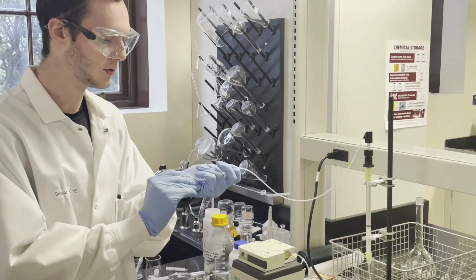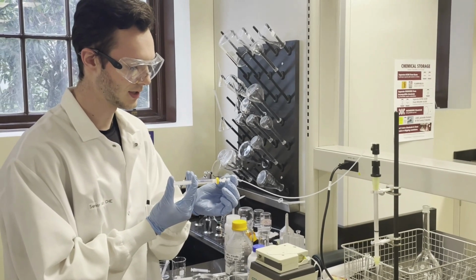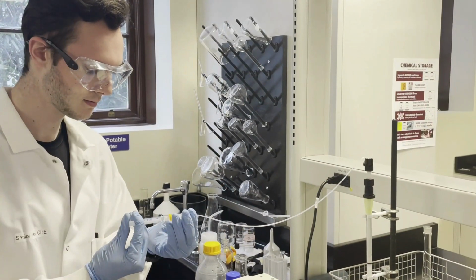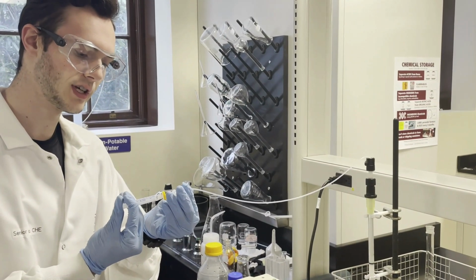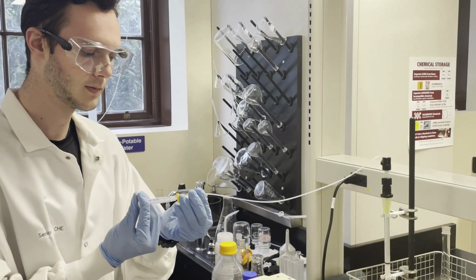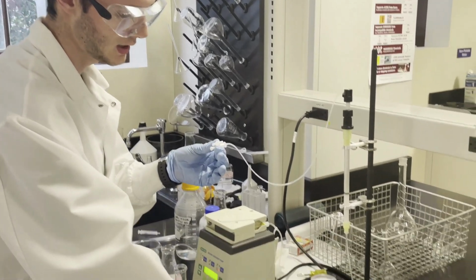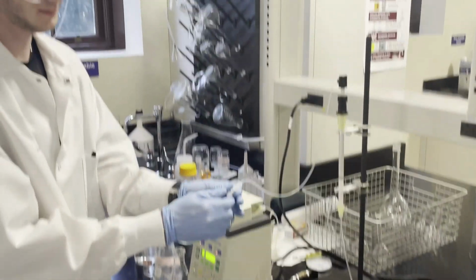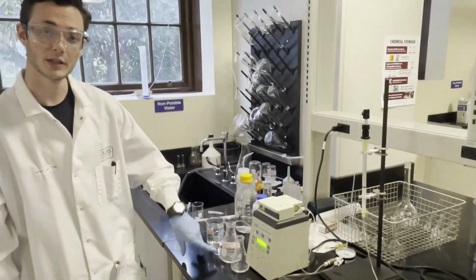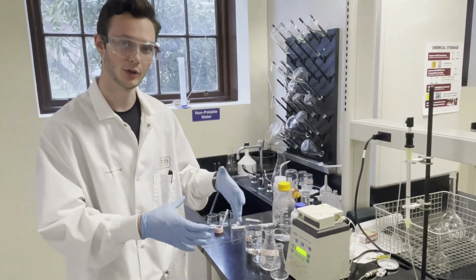Now, I'm going to very carefully start applying pressure and loading the proteins into the column. And so now that we're reaching the end, we want to make sure we get every last little bit of protein out, and then we just disconnect the same way we connected and connect it back to the pump. Voila. Now we're going to turn the pump back on and continue pumping the loading buffer through to help elute all of the positively charged protein, in our case, the lysozyme.